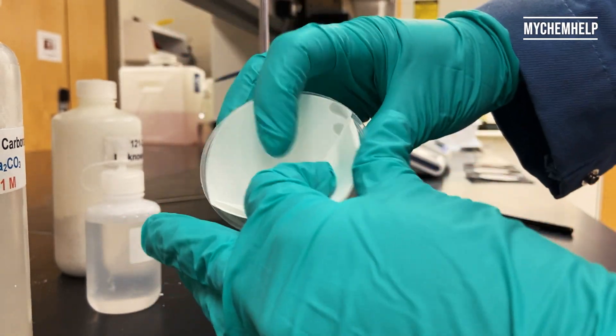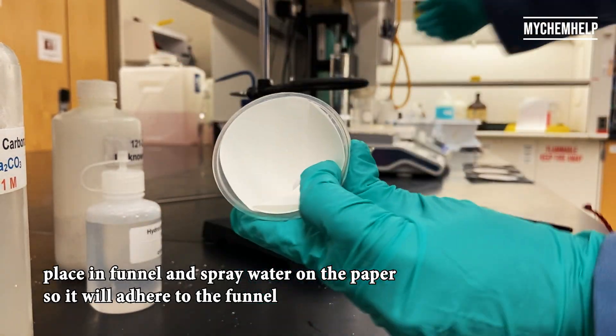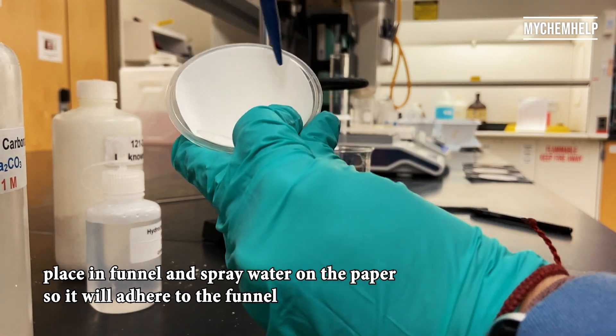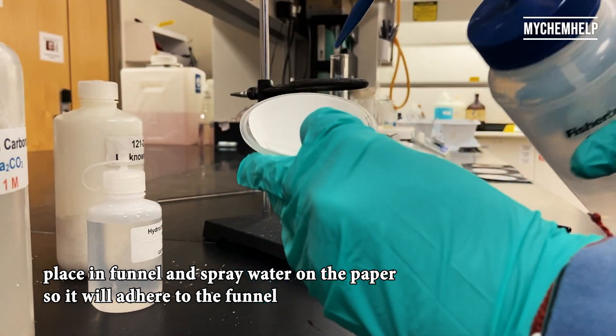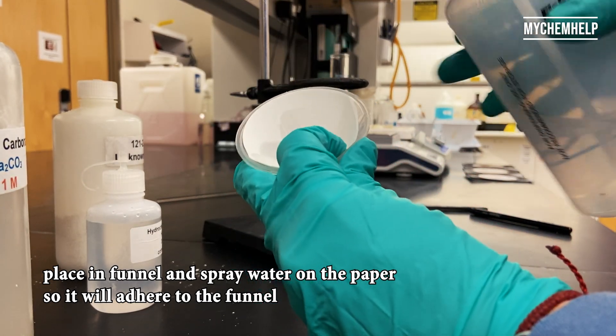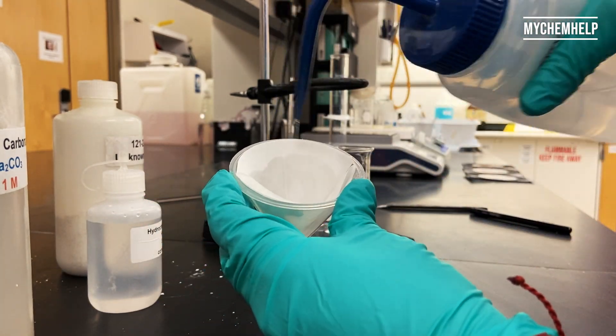And then you stick it right in the funnel. And I like to spray it with a little bit of water just to get it to adhere to the funnel. And we're good to go.